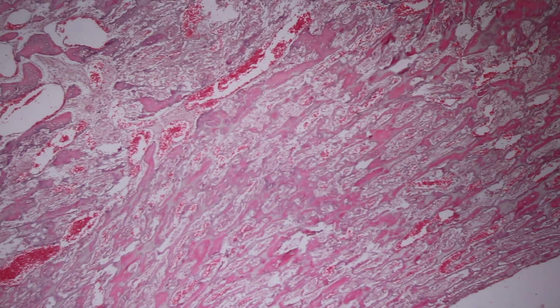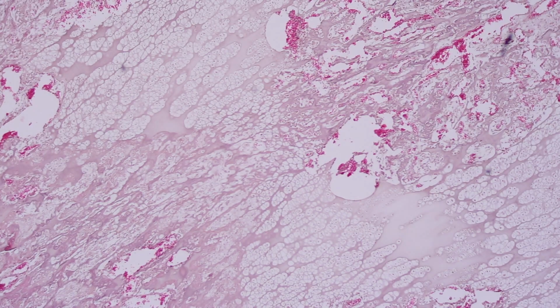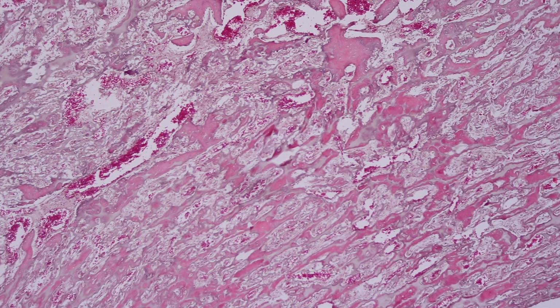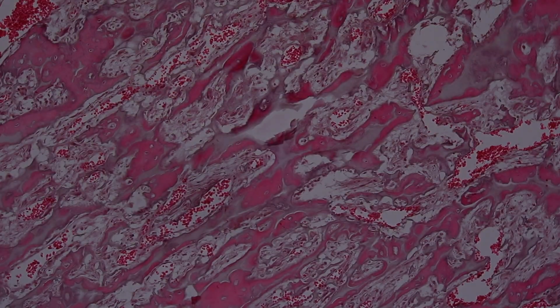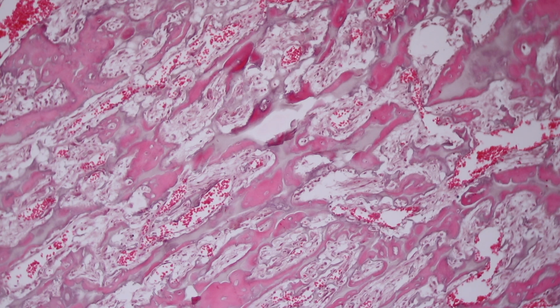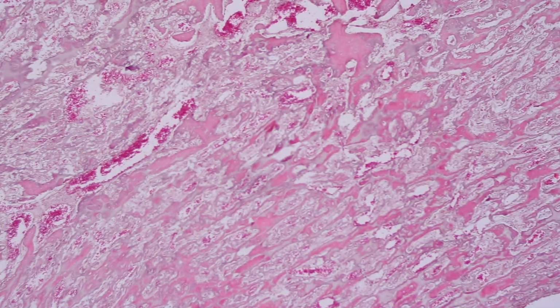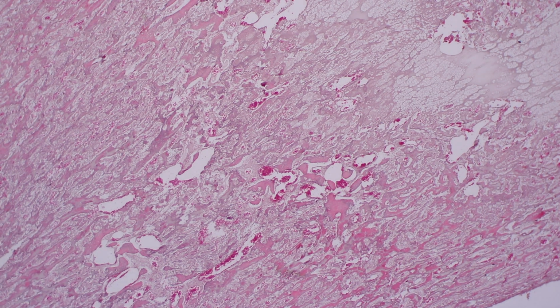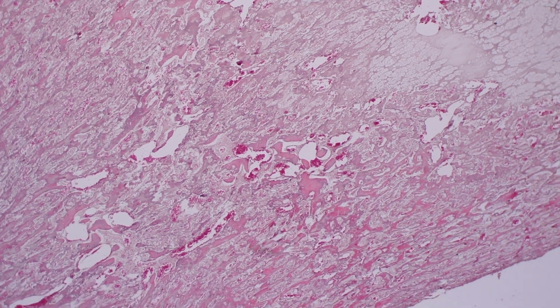Or we can have diseases that affect the skeleton because maybe not the osteoblasts are dysfunctional, but the osteoclasts are. If the osteoclasts are not functional, bone formation occurs, primary spongiosa develops, but it's not resorbed. So we are looking in the medullary cavity of a fetus that died soon after birth.